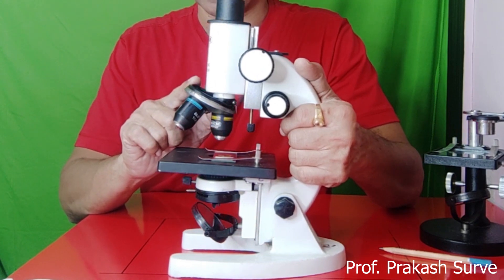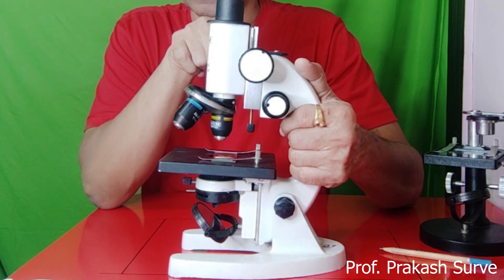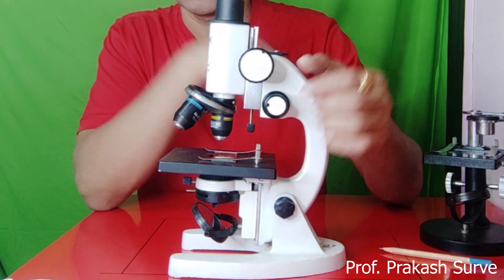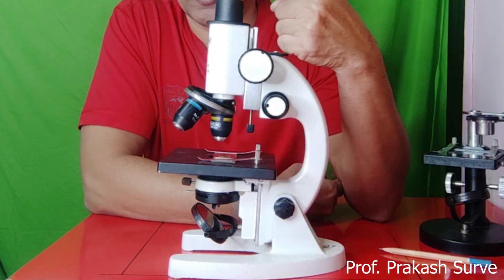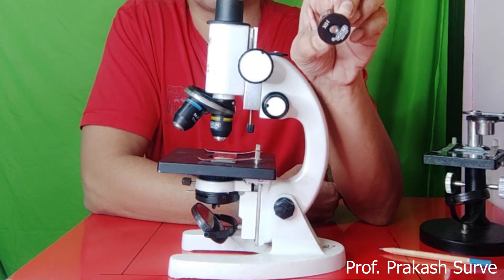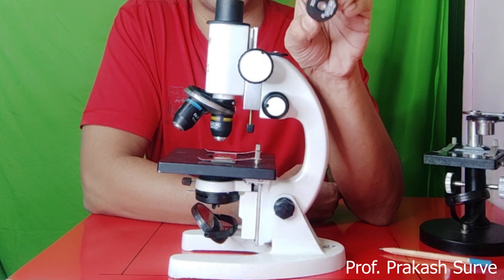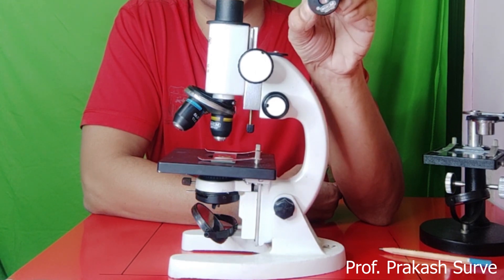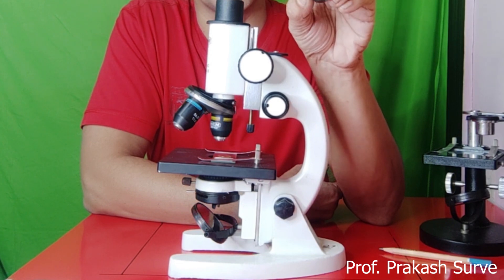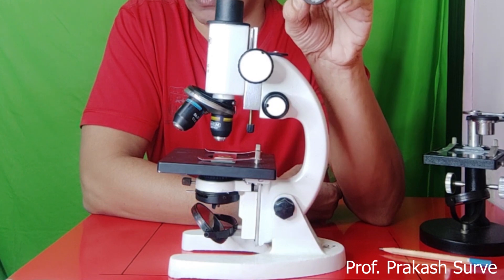The draw tube is a smaller tube fixed to the upper end of the body tube, which holds the eyepiece. The eyepiece comes in different powers — 5x, 10x, 15x, or 20x — depending on what type of microorganism you want to observe.